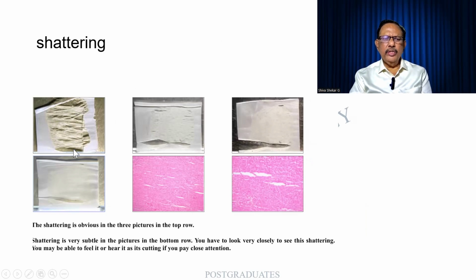Shattering. So what is this? There is some kind of compression and you find that there is a break in the tissue. So this is also over here, whereas it is relatively better in this form.